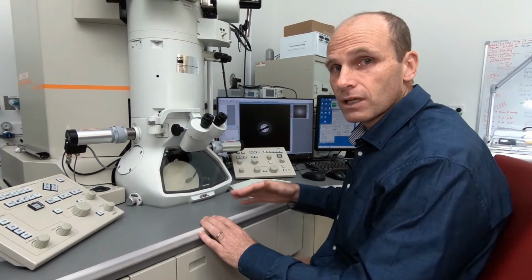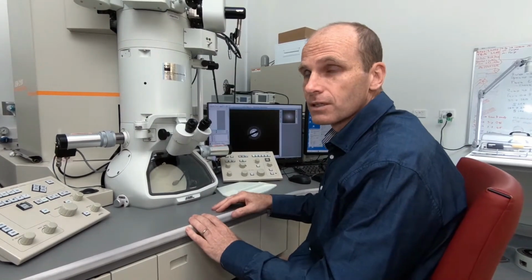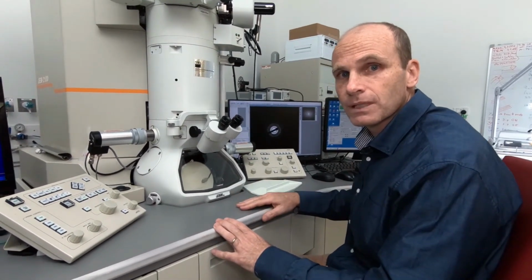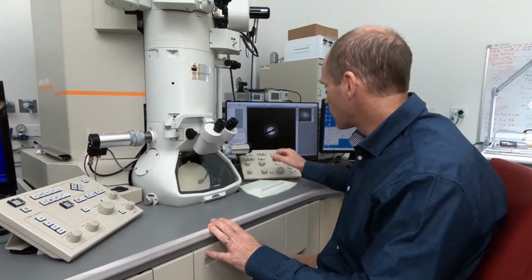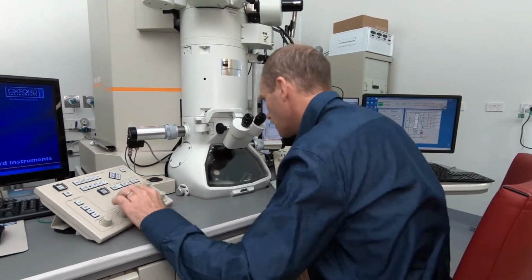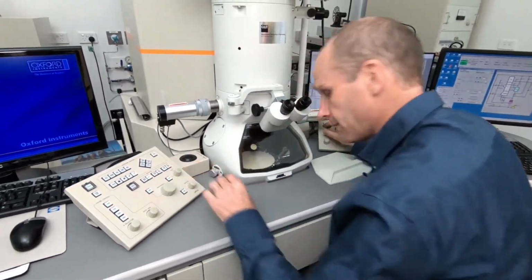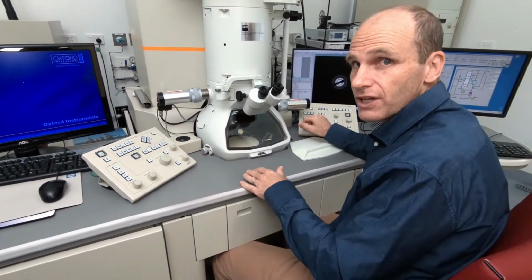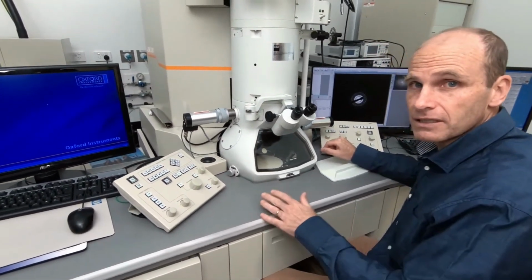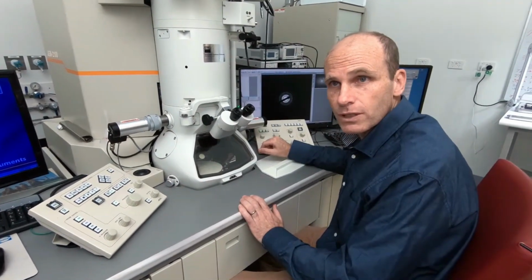We can measure these and we can clearly identify that the sample that we're looking at is actually gold, as we expect. So it's a very powerful technique and one which a lot of people use in transmission electron microscopy. And now we'll go back to normal imaging mode. And at that point we probably have enough information from our sample to be able to carry out the experiment. So here I'd go ahead and then take out the sample and let the next person go and carry out their experiments with it as well.